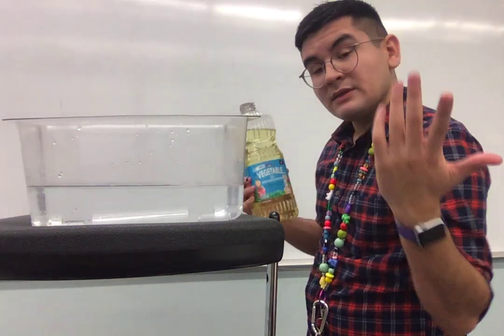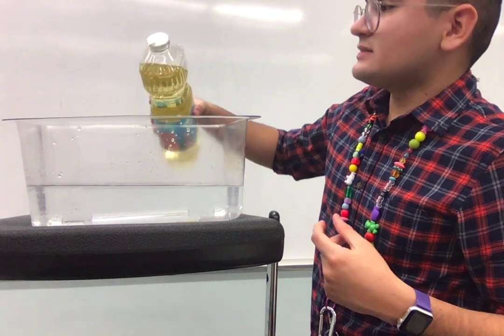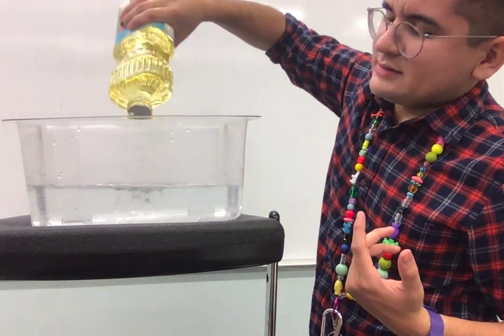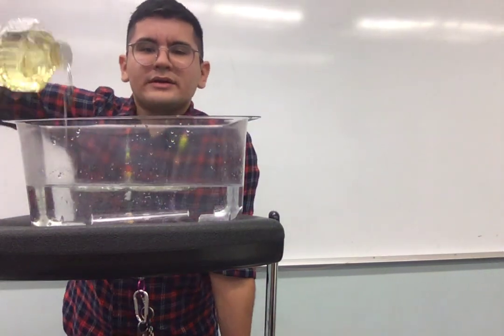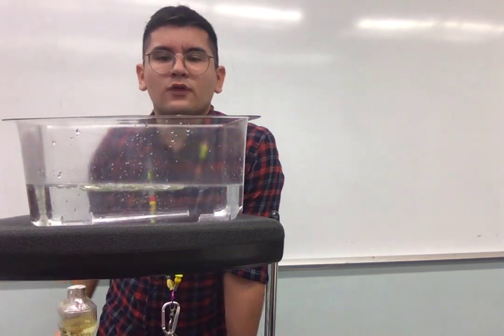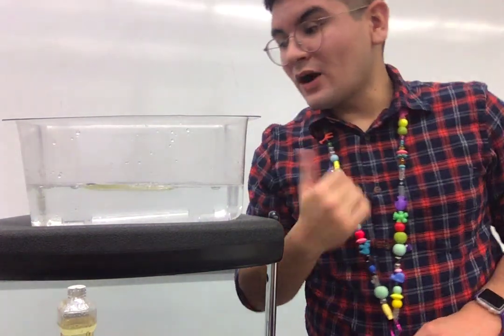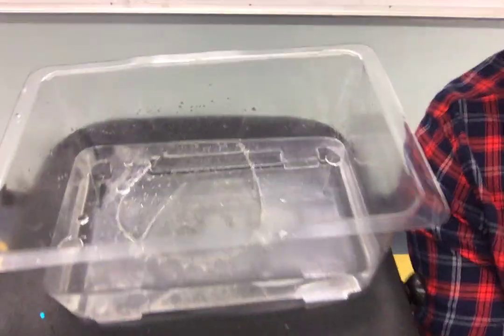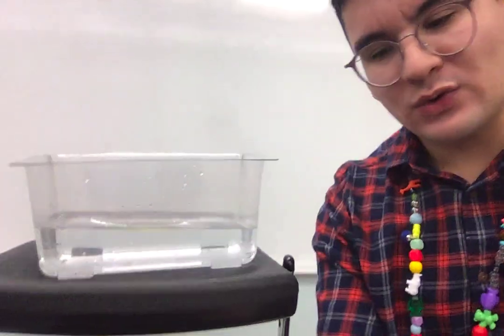So believe it or not, some liquids can dissolve, right? Some liquids can't. So that's what we're gonna test today. Let's see. Ready, I'm gonna pour, let's see, a lot. What do you notice is happening? I'm gonna stand behind here so you can see a little bit better. If you notice, there's little bubbles forming in the oil. I'm sorry, in the water. Now I'm actually gonna move my computer screen so you can see a little bit better. Notice how the oil does not mix with the water.